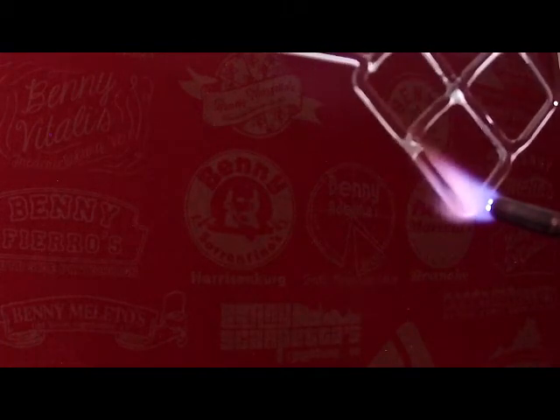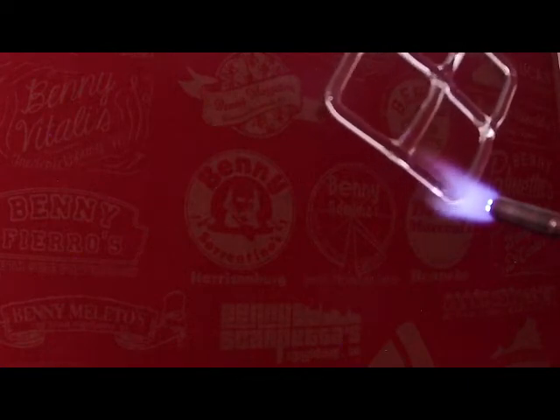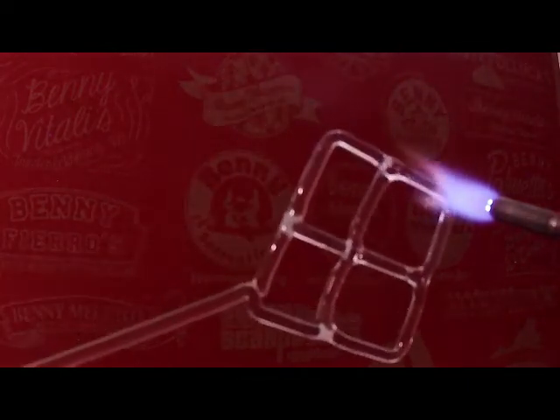From a stress point of view, or to try and minimize some stress, I'm going to come back to all four corners and warm them up till they become a little bit soft. Okay, I don't want them moving too much. So, do that.